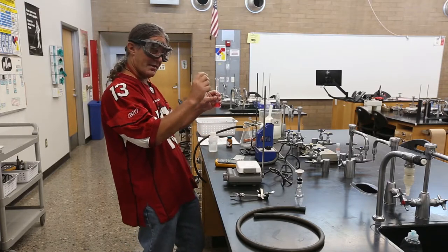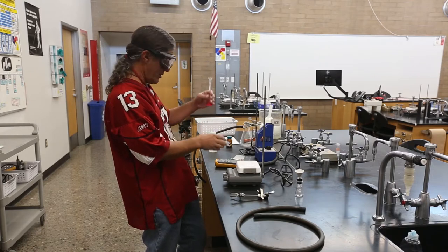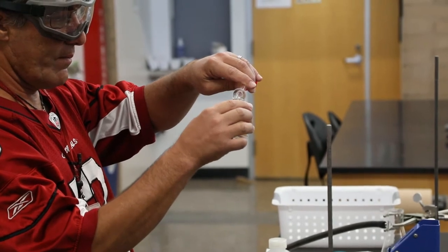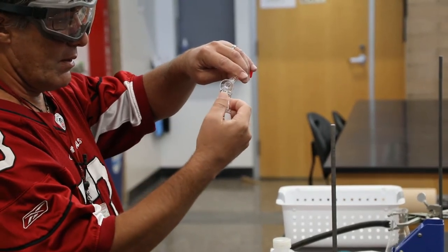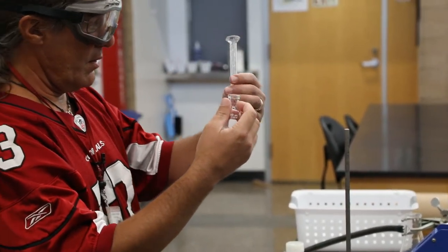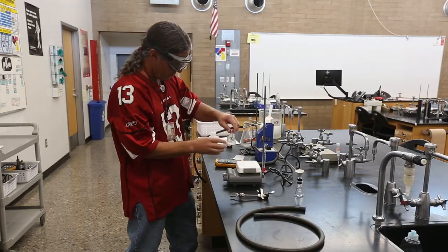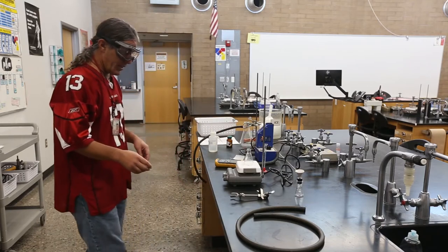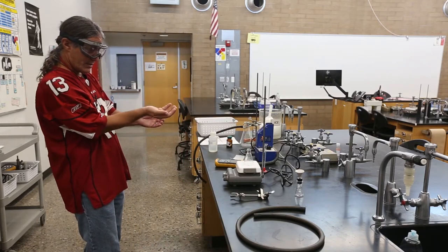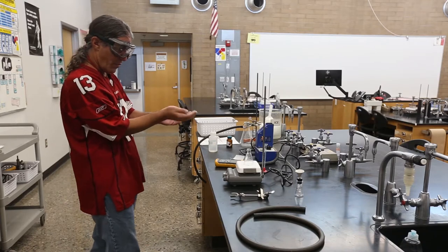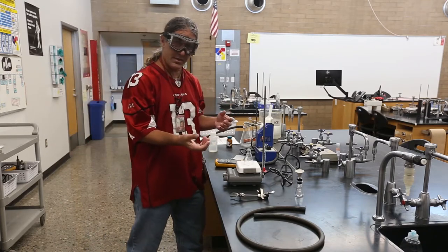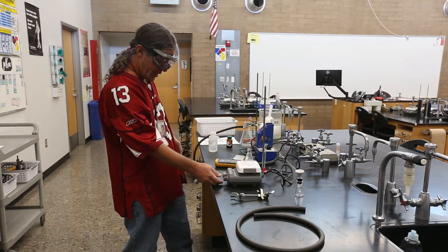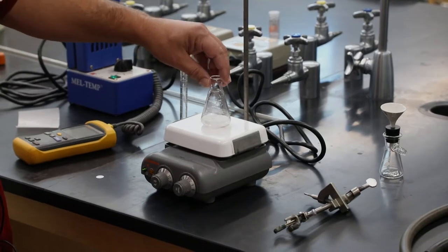If it doesn't, I can add a little milliliter later. So I'm thinking maybe I'll even go with 8. So I'm going to put in a little less than 10 milliliters of water. Yeah, we've got about 9 milliliters of water in there. And then I'm going to put it on the hot plate. In the distillation we use the heating mantle, which has a space for heating that's appropriate for a round device. Since we're using a flat bottomed Erlenmeyer, we're going to use a hot plate to go ahead and warm this up.